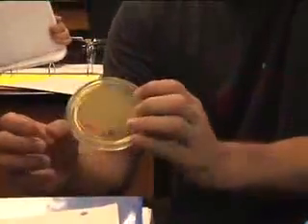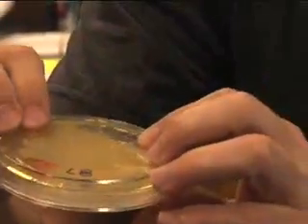This is the bacteria — the pure bacteria without transformation — and they grow very, very well. But this doesn't have ampicillin? It doesn't have ampicillin or anything. It's just the LB, just the growing media. But the same one, when you put it in plain LB with ampicillin, it did not grow at all. Because it doesn't have resistance.